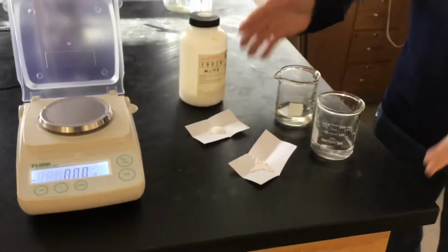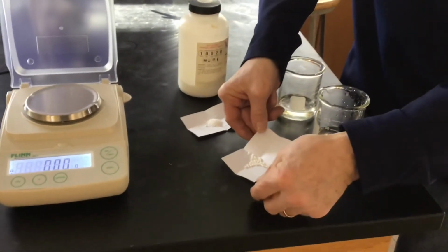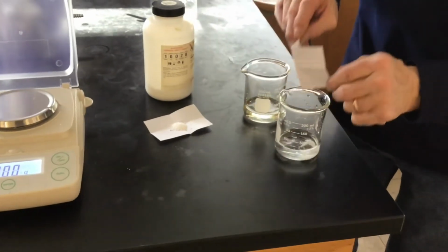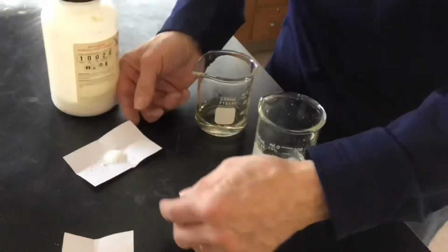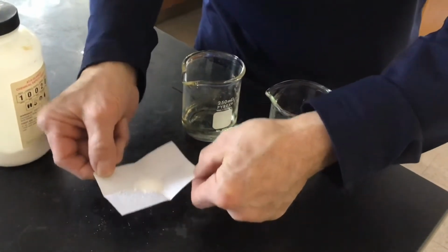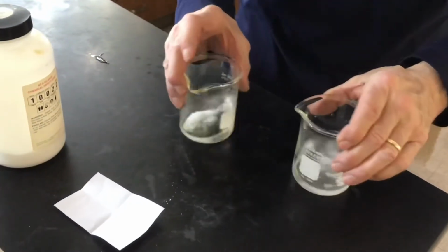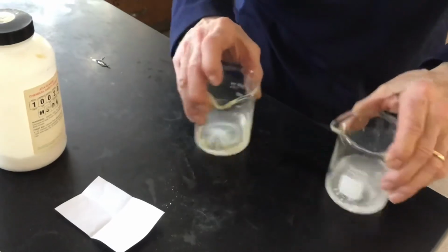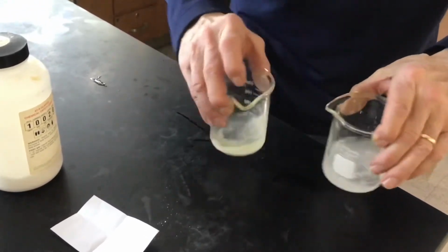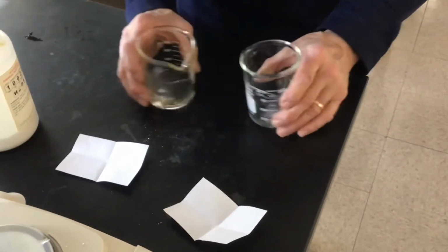Okay, so here they are dry. I know Mr. Moore was mentioning that. Here's the calcium chloride. These nice little round pellets. I hope I don't drop any. So we'll dump those into some water. This is the sodium phosphate. We'll dump that in. And we've got to get them to dissolve first. They have to be aqueous in order to react. Just about got it.